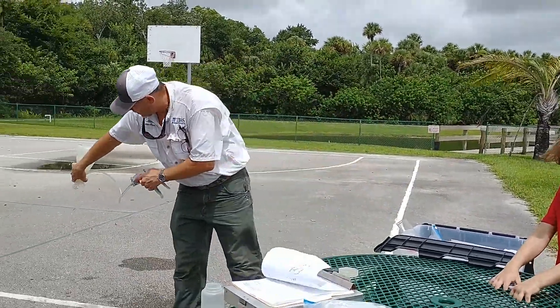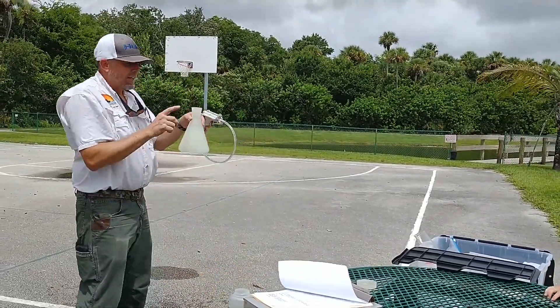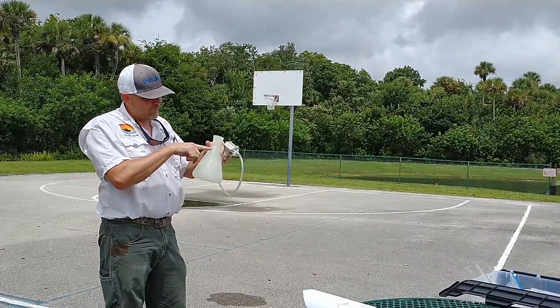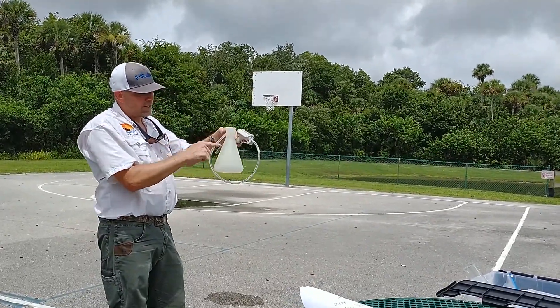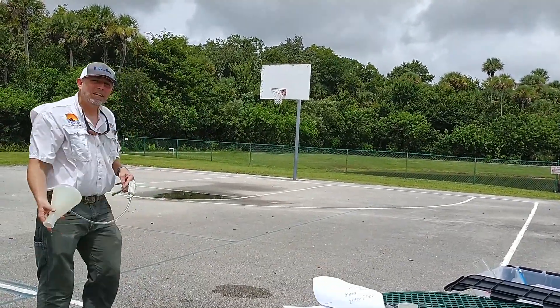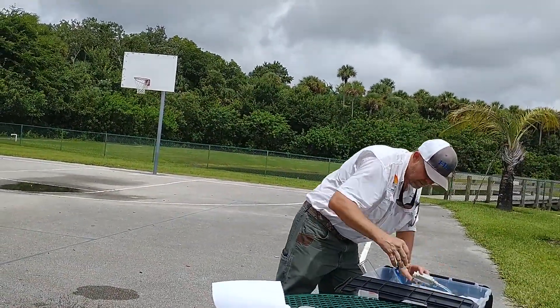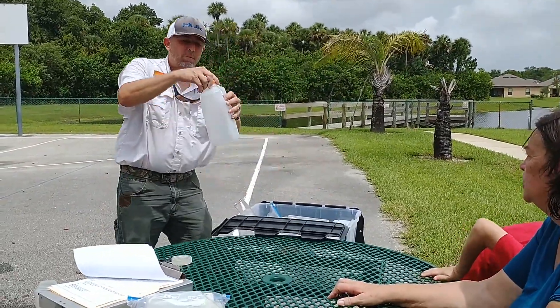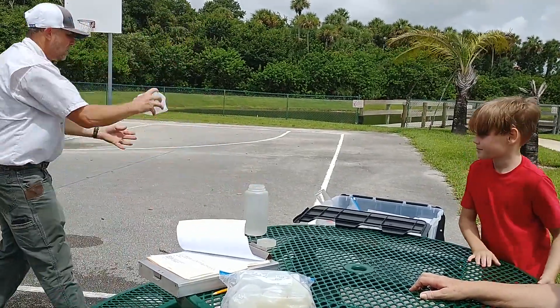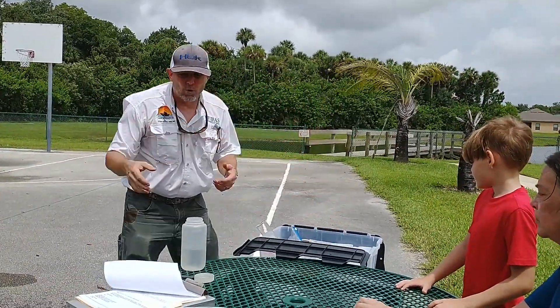This here — allergy-free water — put a little bit of water in it. I dump this every time and I train people to do that. If you're filtering 500 and you forget, the water will come into this tube, get in this pump and kill it. So always dump everything. However, if you're doing 150, you can do all three without dumping because this holds 1,000. But we still rinse it and put it upside down so it can dry. Same thing with bottle number two — take the lid off so it doesn't get frozen, put a little tap water in it, dump it, and leave the lid off so it can dry without algae growth.